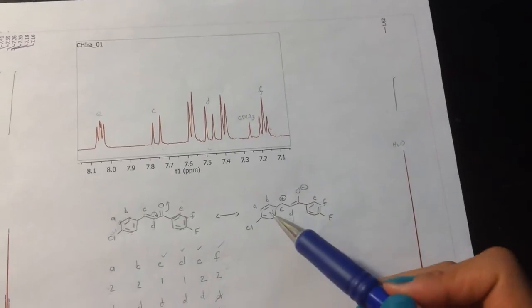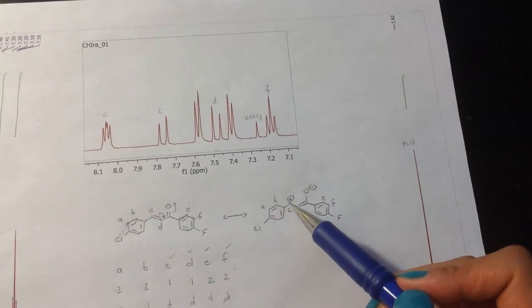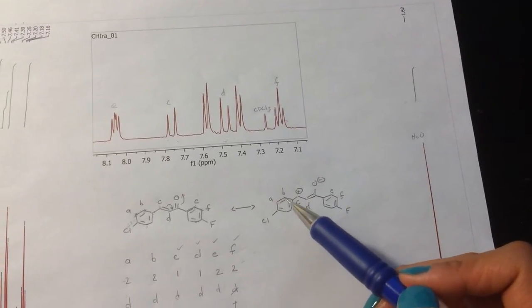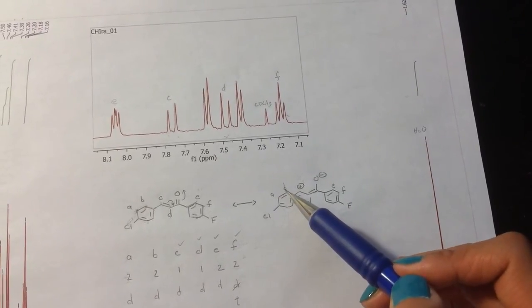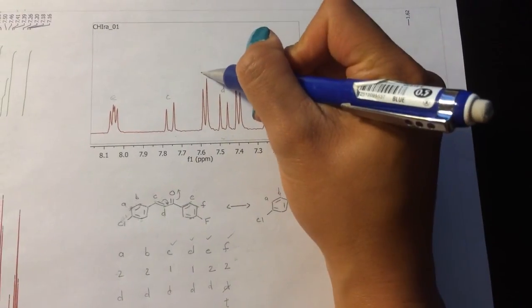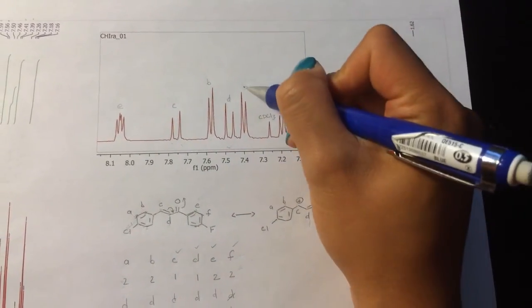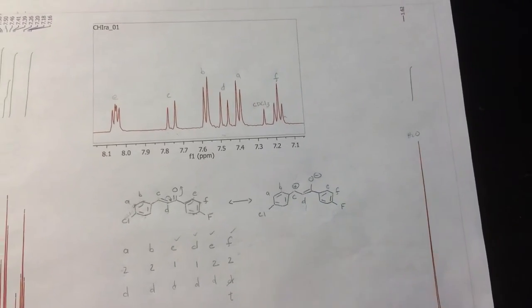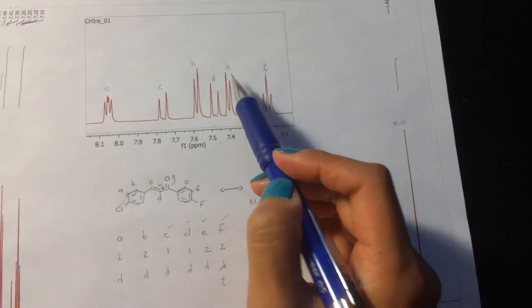And so we should be looking at this structure here. If there is a positive charge sitting here, you can imagine that there's going to be more electron density being pulled away. And so B is going to feel it more. So this is going to be B, since it's more de-shielded, and this guy will be A. This is a little tricky because A is sitting next to the chlorine, so some of you may have assigned this one as A and this one as B.